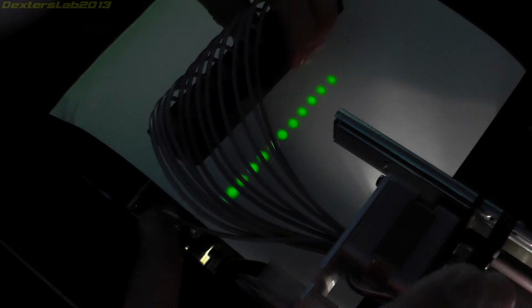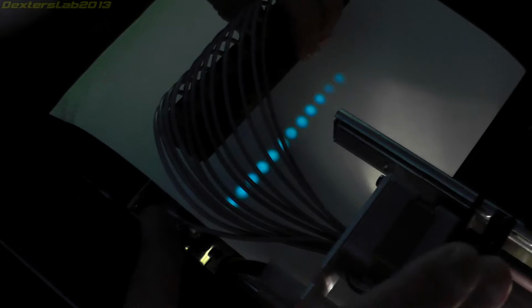Again, that one's pretty much the same, but it might not necessarily be filtering colours that we can really see. So, no, that one's green. And that one, again, not really sure. That one's sort of a turquoise colour. Again, that looks white to me. Oh, that one's definitely blue. White again. I think we're back to where we started. Red, yeah.